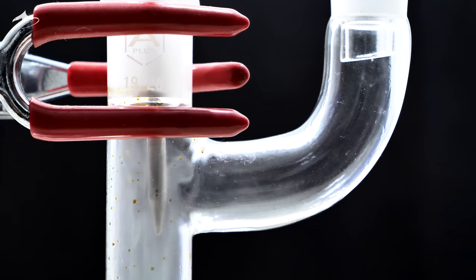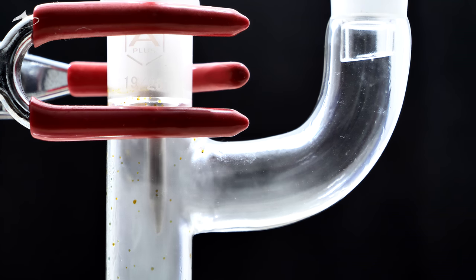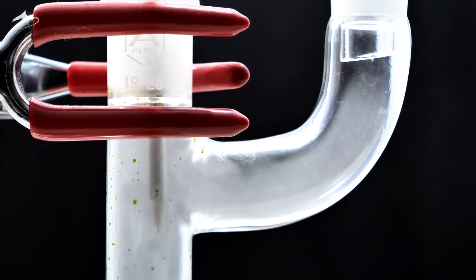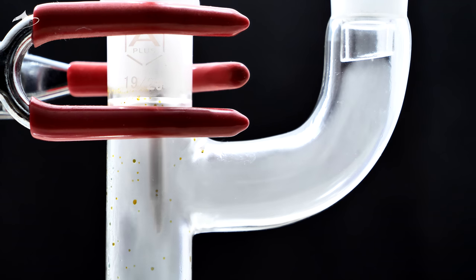Unfortunately, this procedure has the disadvantage of producing a side product, which is what appears here as white fumes. As soon as some butyric acid is produced, in the presence of fresh butyl alcohol and sulfuric acid, some butyl butyrate is produced. Butyl butyrate is a volatile compound that forms an azeotrope with water, which is what you are seeing here.